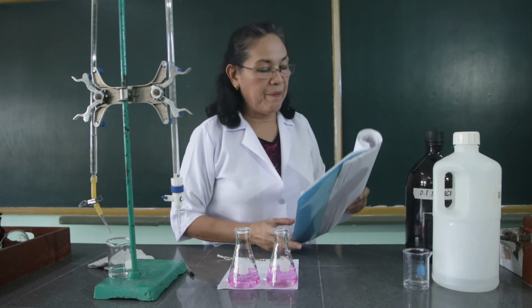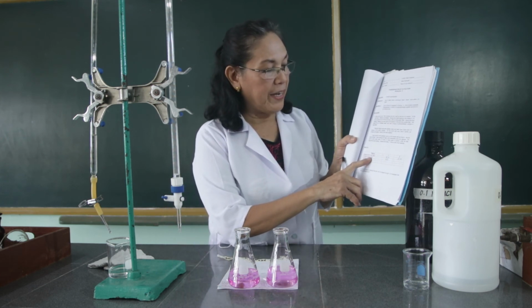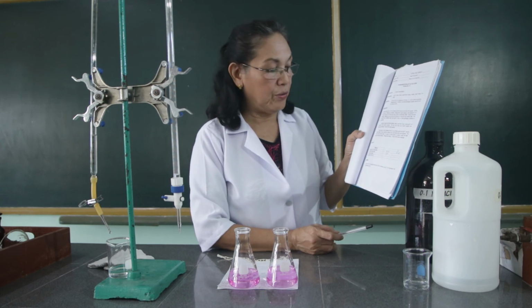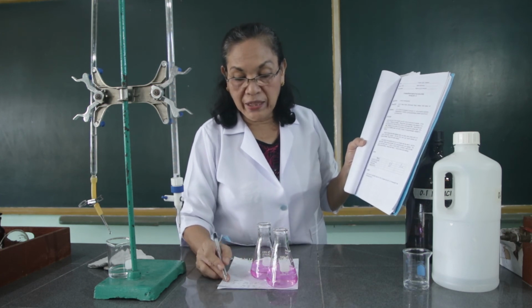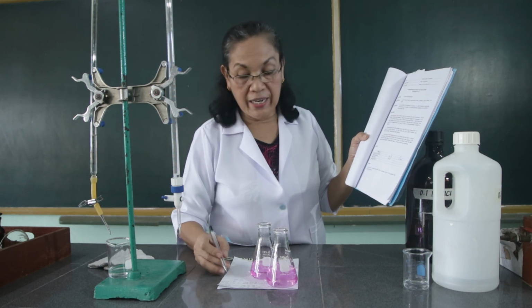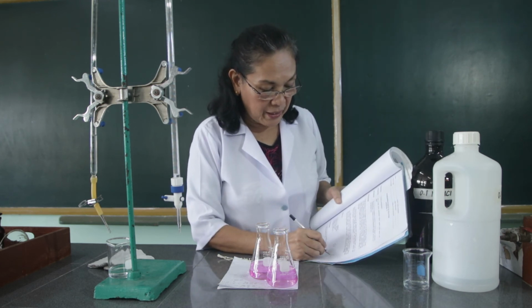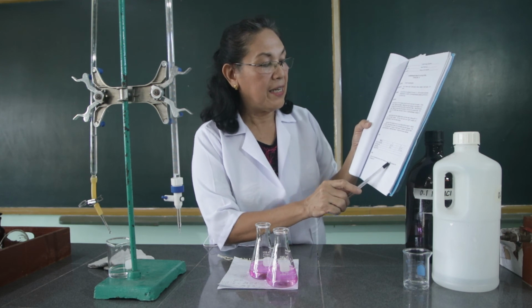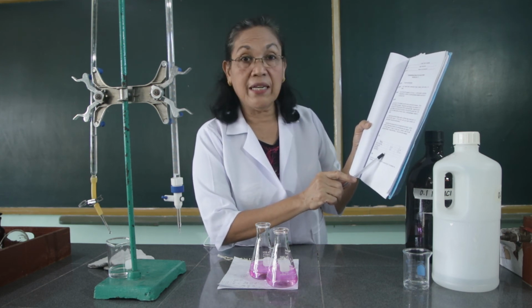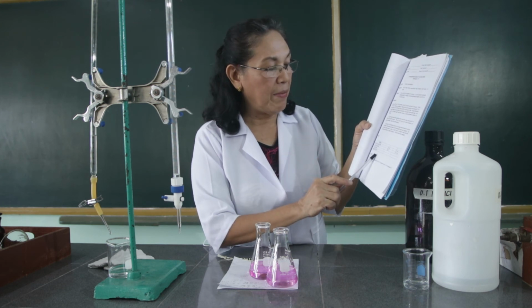in filling up the table in your lab guide. So look at your table there. You have the volume of hydrochloric acid used. We used 25 ml for trial 1 as well as 25 ml for trial 2. Then the volume of base used for trial 1, we have recorded that data. We have 21.9 ml. And for trial 2, it's 22.3 ml. So you write it here, 22.3 ml. So you can now solve for the normality of the hydrochloric acid and the normality of the base. Since you have already computed this a while ago, you use that as the normality of the base, and you can solve already the normality of the hydrochloric acid.